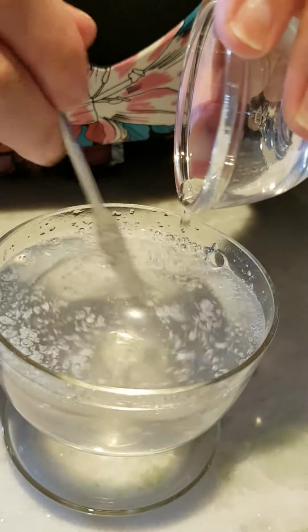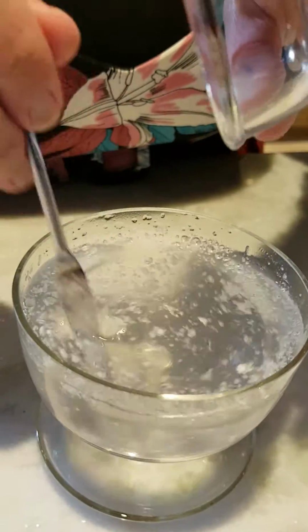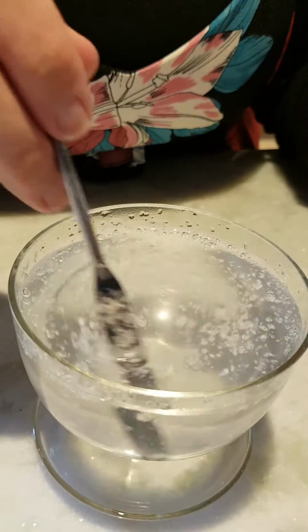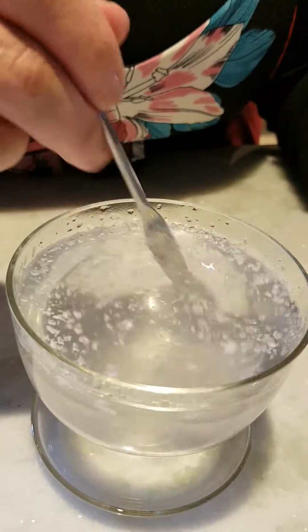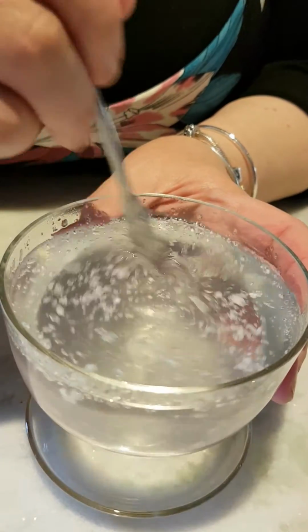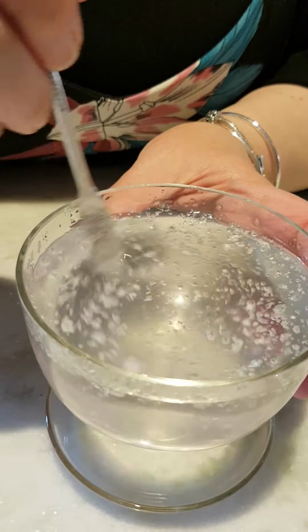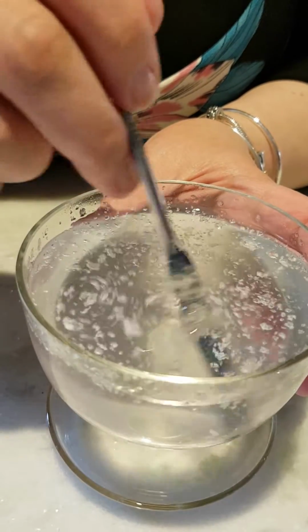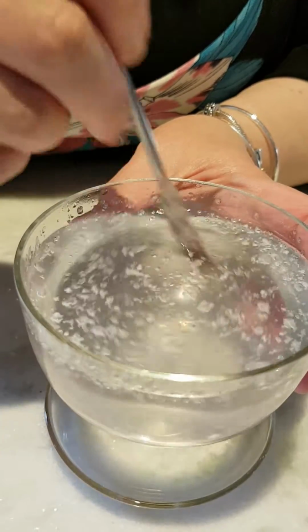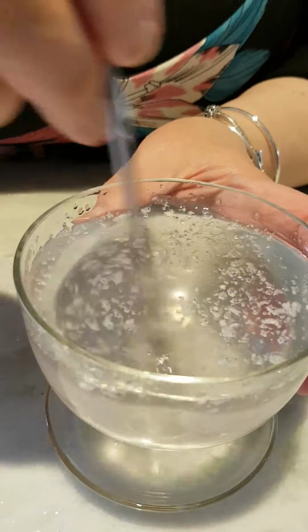It's thickening even further. Slightly clear, but not really clear. There wasn't a 2.4 gram amount of the sodium hydroxide, so that could possibly be part of the component that it's not clearing.